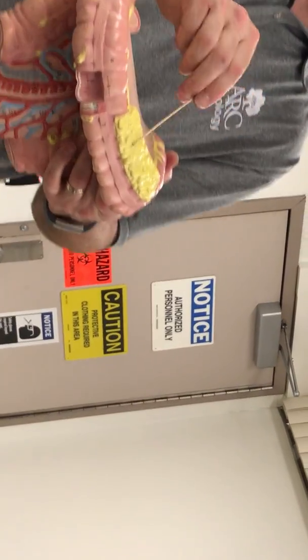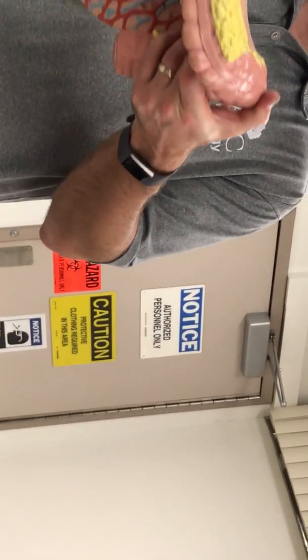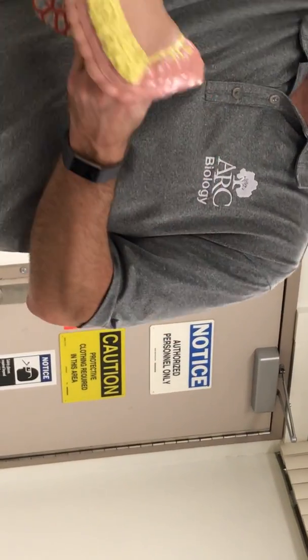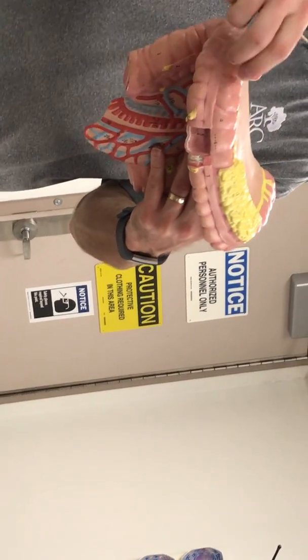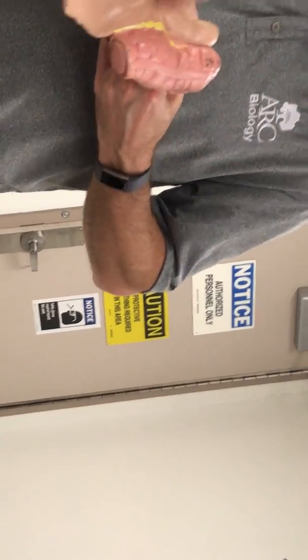The yellow here is adipose. Which mesentery is it? All the yellow's adipose. Greater omentum. It drapes down, comes back, and attaches to the top there. And then what about this connective tissue here? It's attaching the transverse colon to the dorsal body wall. The transverse mesocolon. And this retroperitoneal organ back here, the duodenum.